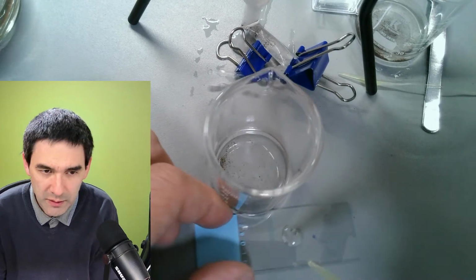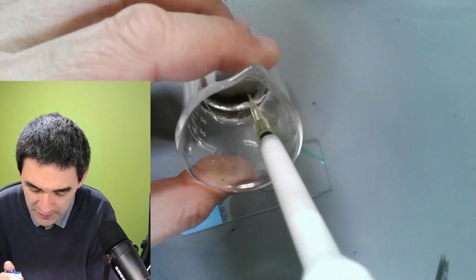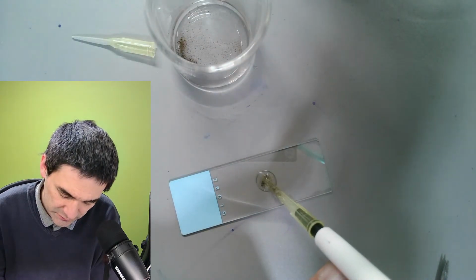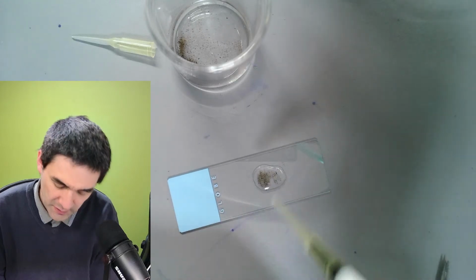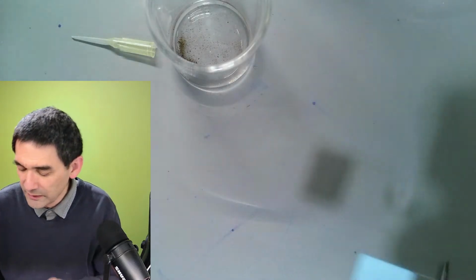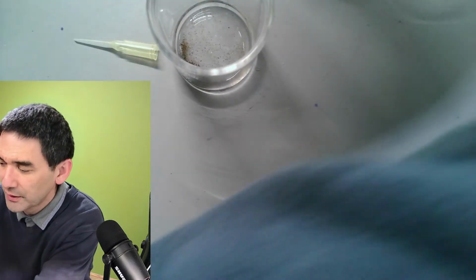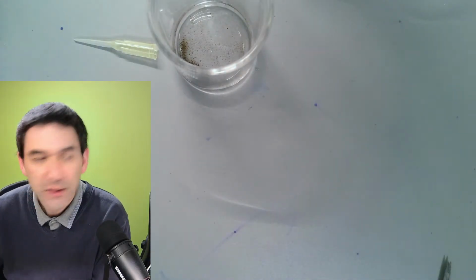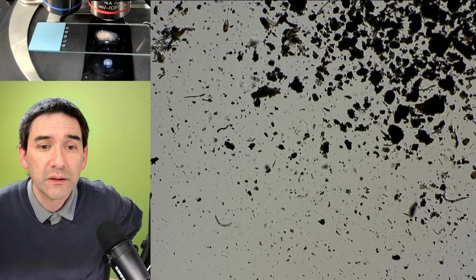It's quite interesting, even though there's so many solid particles in here, it still won't take it up quite as easily. Okay, now I got more. You probably want to spread it apart. Okay, and then I quickly check it, and now I'm going to move this thing away here, because I just want to observe if we're able to see anything of interest here. So again, the scope view, the arrow is gone.